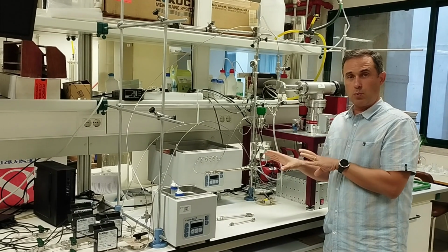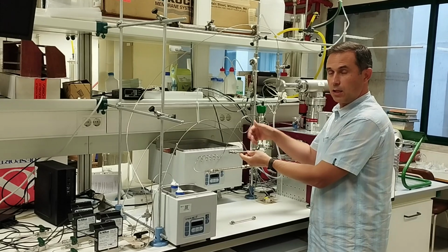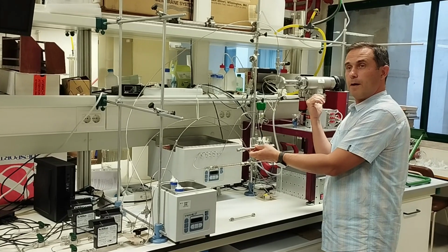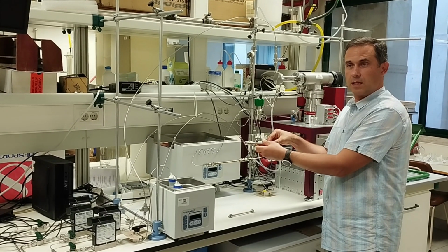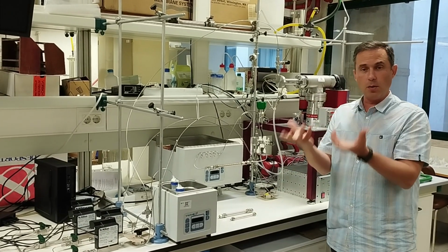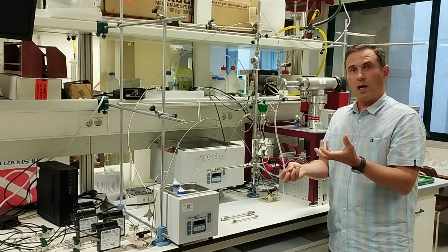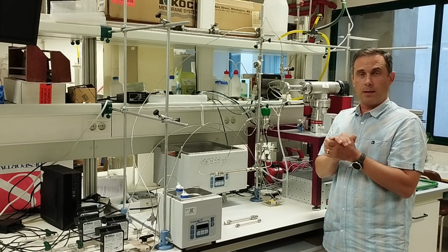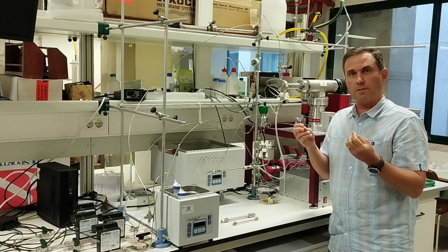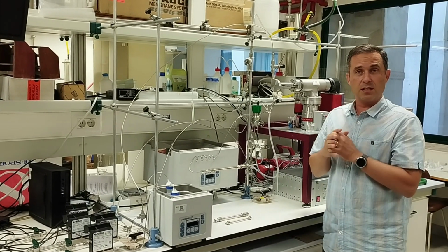Another type of experiment that we can do in here is to adsorb some vapors inside the columns at low temperature, and then heat up these columns and see how the vapors are being removed. This is a temperature programmed desorption type of experiment, and if, for instance, we adsorb different vapors at the same time, we can understand which are the ones that are going out at lower temperatures and the ones that are going out at higher temperatures. And this gives fundamental information on the binding energy and also, of course, on the performance of the materials.